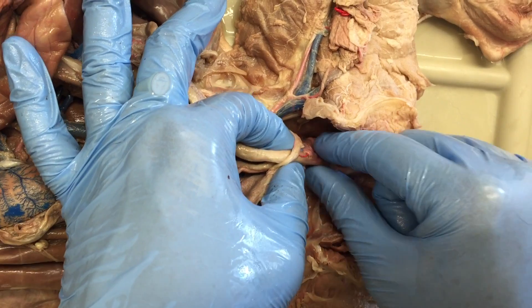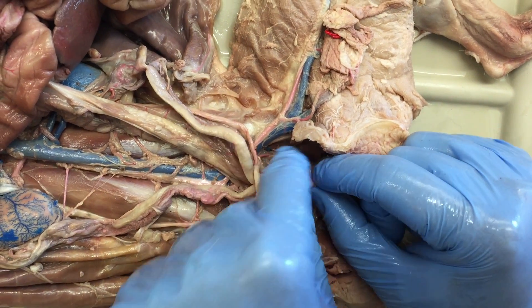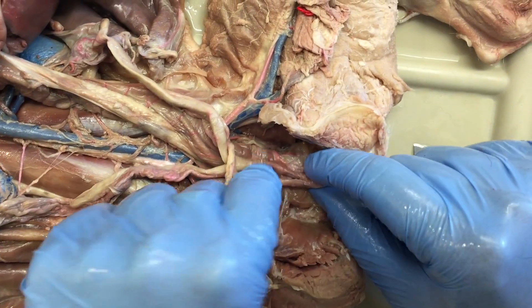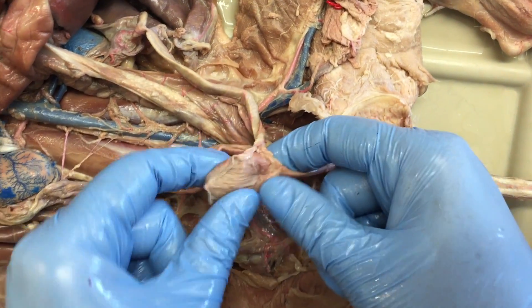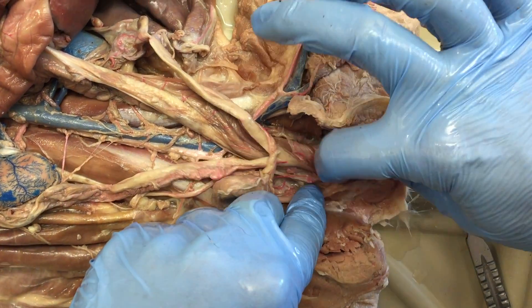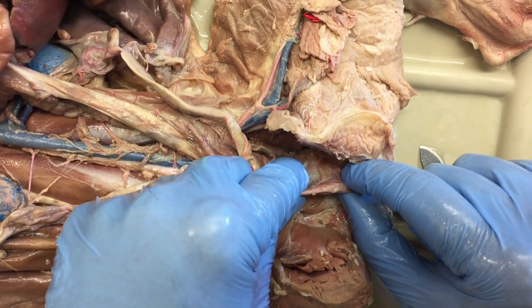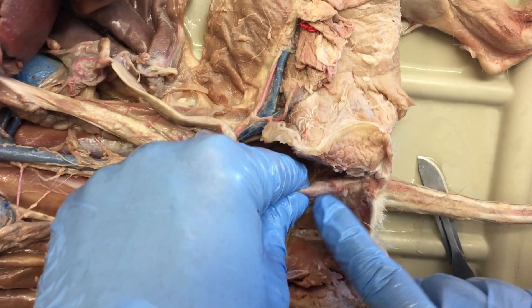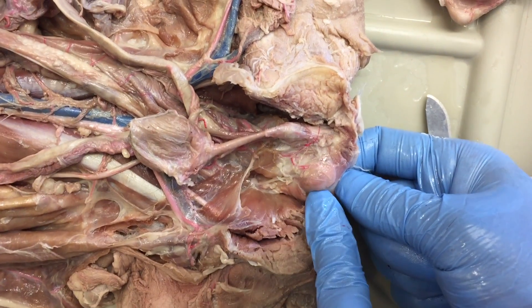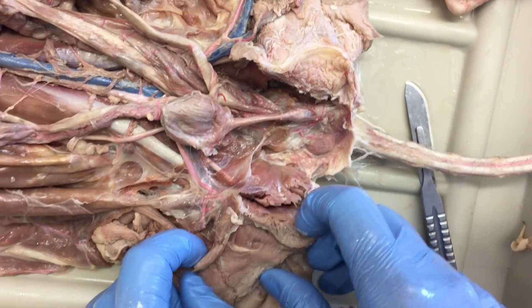Right about here is where you have the cervix, and that's what separates the body of the uterus from the vagina — so up here is uterus, down here is vagina. You have your bladder and your urethra, and where the urethra and the vagina meet is where you start calling all of this the urogenital sinus, all the way until you get to the exterior vulva. And then there's an anal gland. I think that's it.